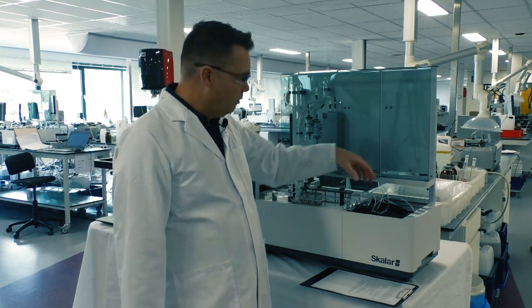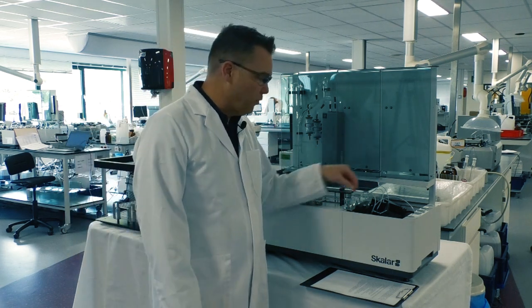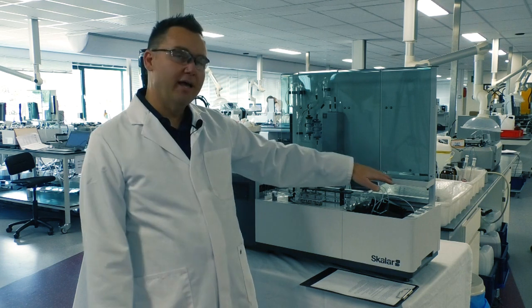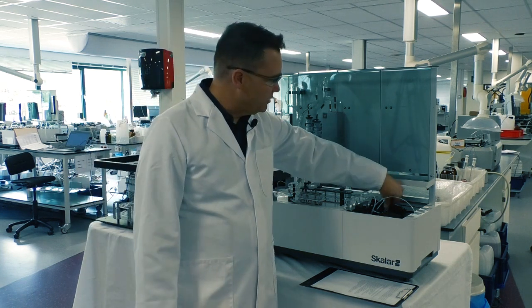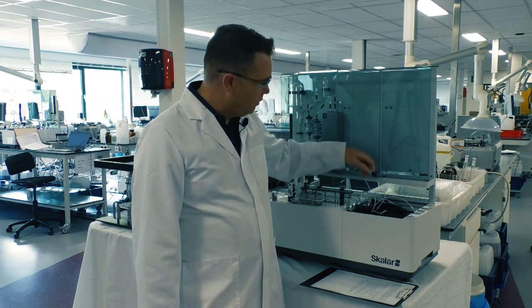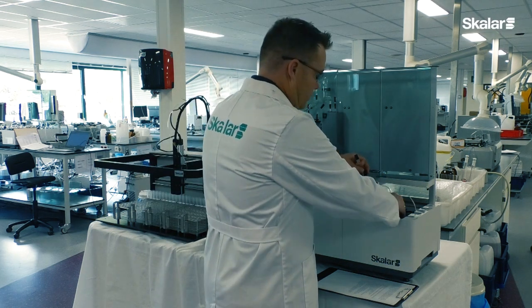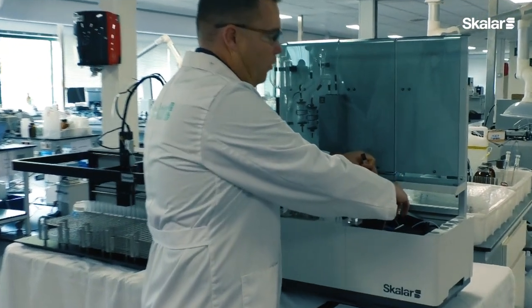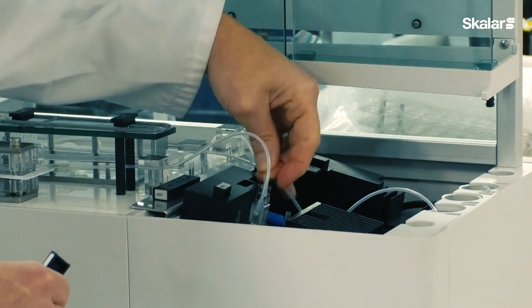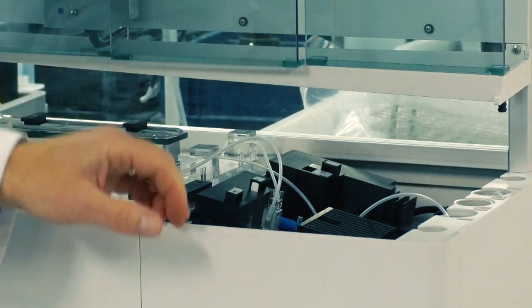So as you notice here, we have a flow cell, and in this case, we're doing nitrate plus nitrite, which we're measuring at 540, and we have our 50 millimeter flow cell here. So if I needed to, let's say that I didn't have the second flow cell back here, and I wanted to run my cyanides, well, I can very easily take the cyanide flow cell along with its wavelength filter, and I can remove the one I have here for ammonia. I can easily move the ammonia wavelength filter, also its flow cell, and just place the flow cell inside of the slot right there, and my wavelength filter, and voila, I'm ready to go.